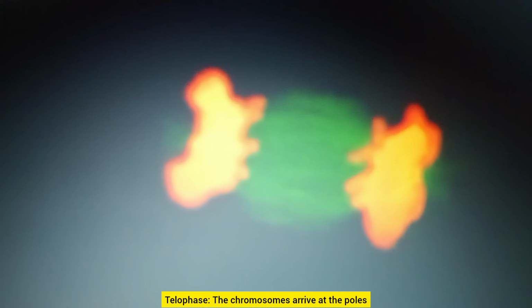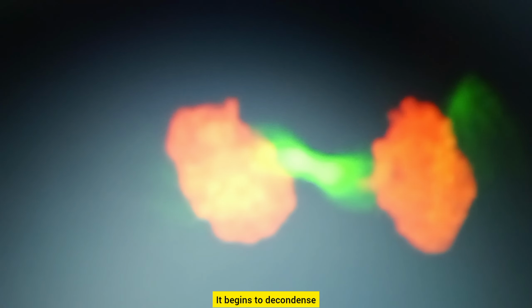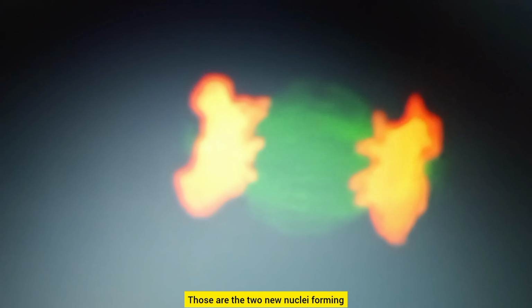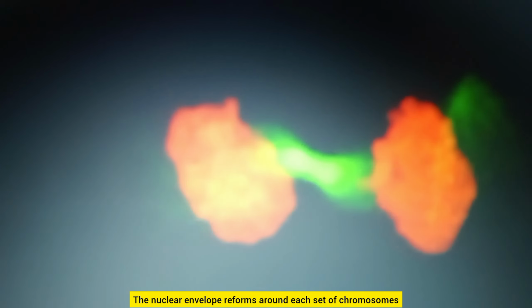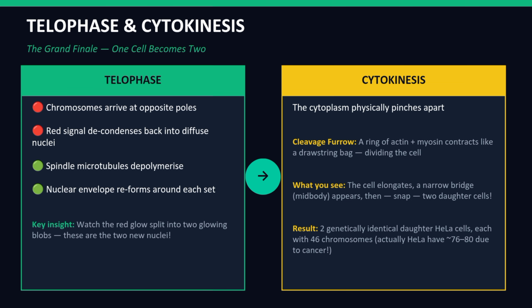Telophase. The chromosomes arrive at the poles. Watch the red signal now. It begins to decondense. Two separate blobs of red appear. Those are the two new nuclei forming. The nuclear envelope reforms around each set of chromosomes. The green spindle begins to break down. And then, the final act.